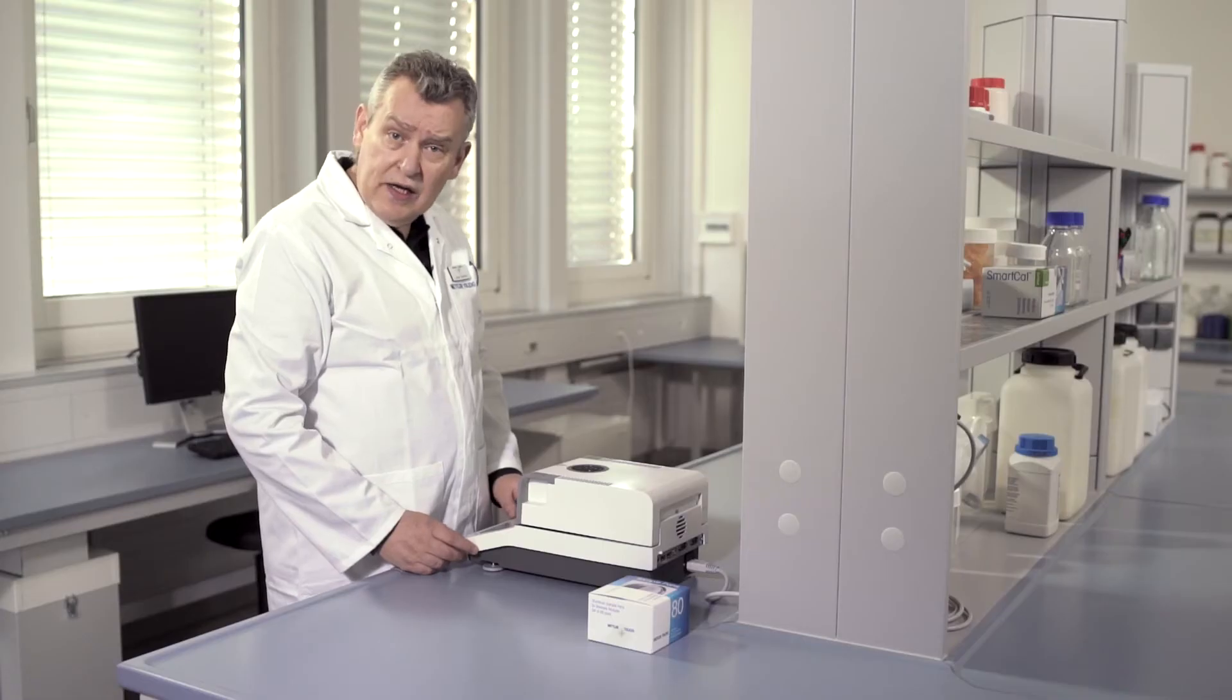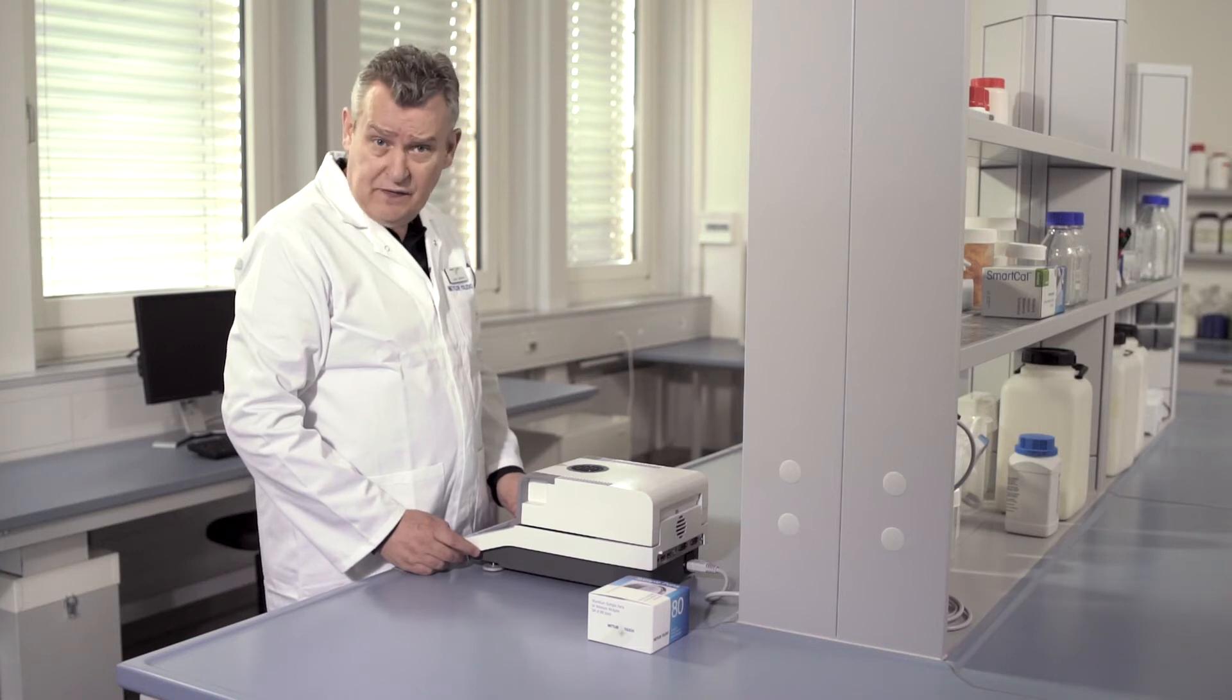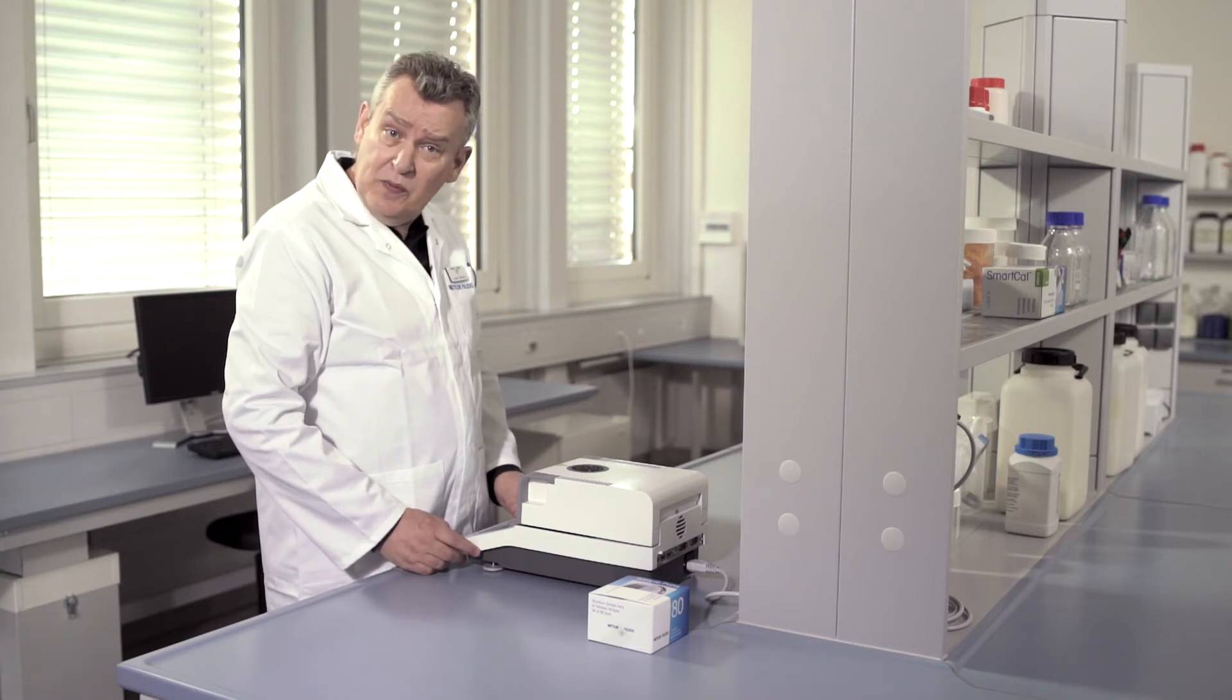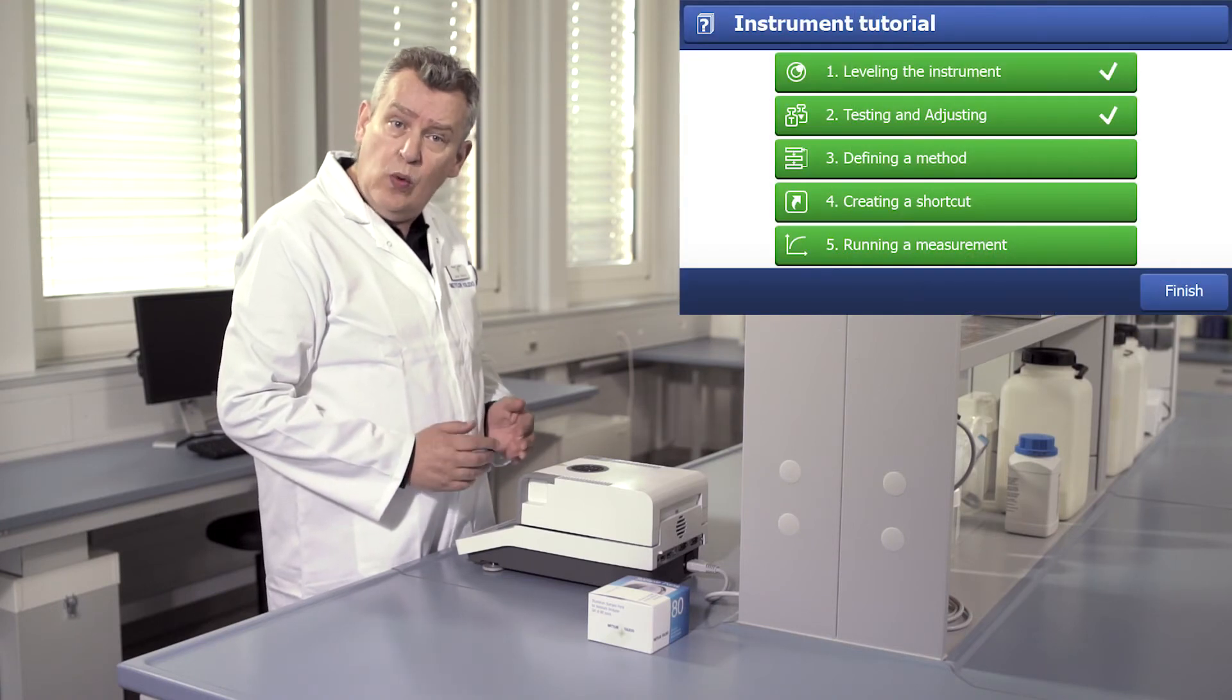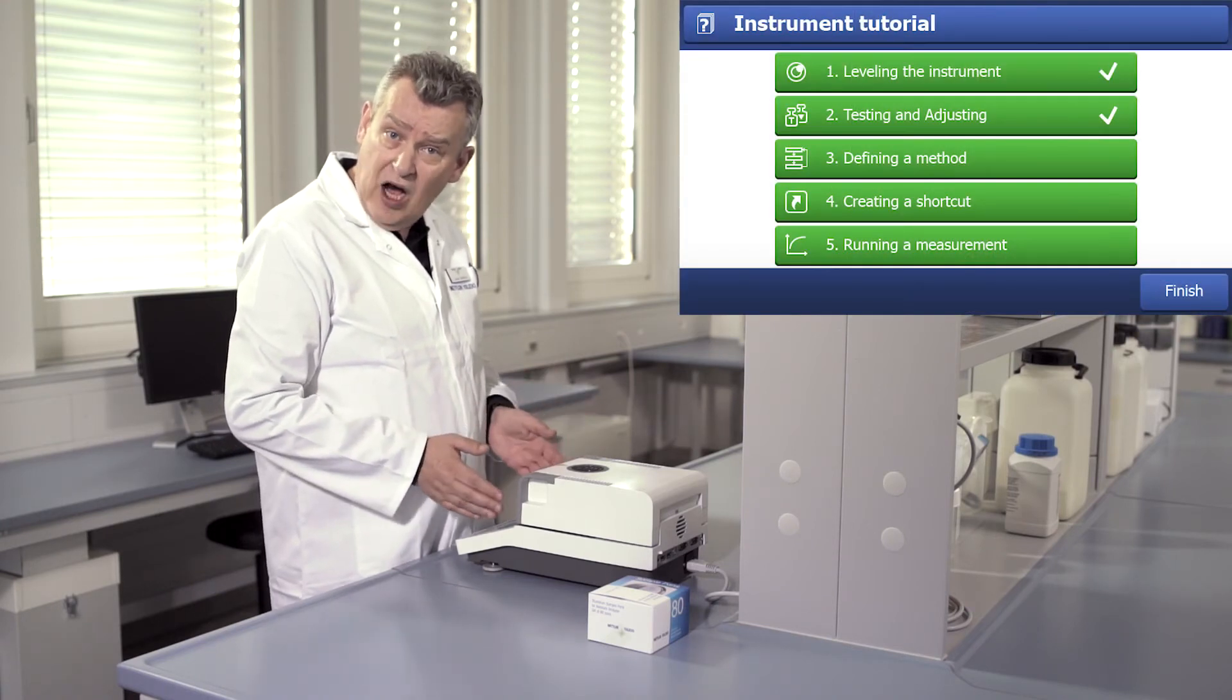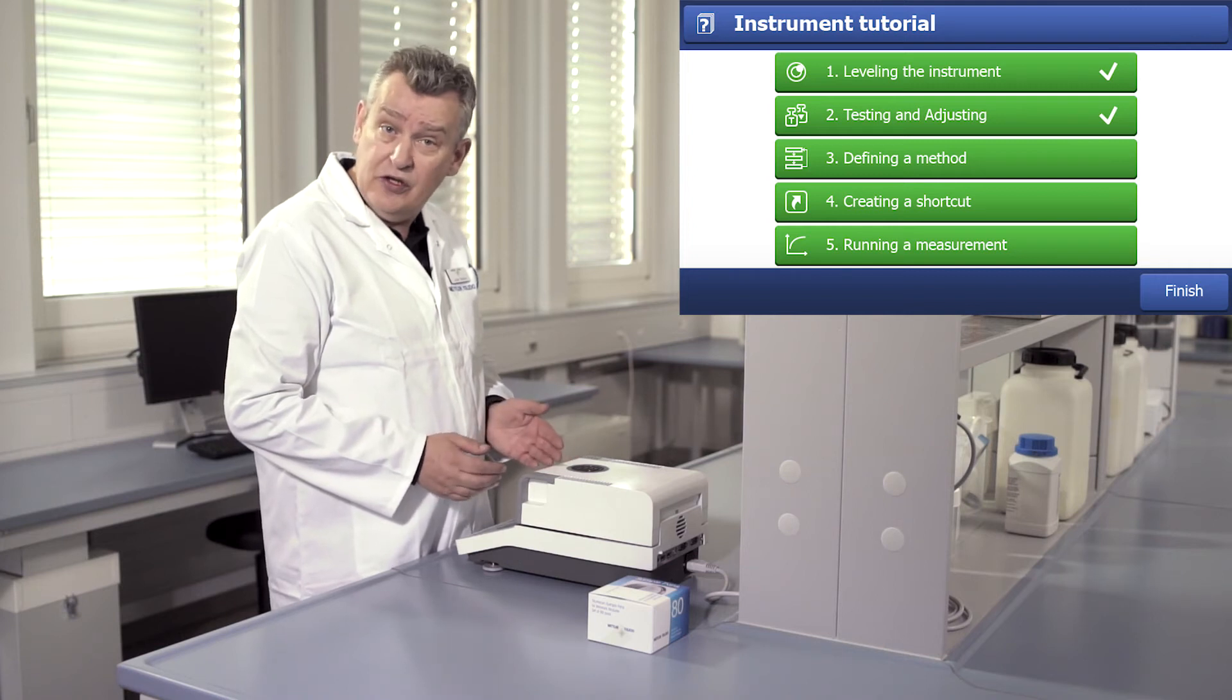You actually don't need to watch this video as the instrument contains a setup wizard and an instrument tutorial which guides you from setting up through to making your first measurement.